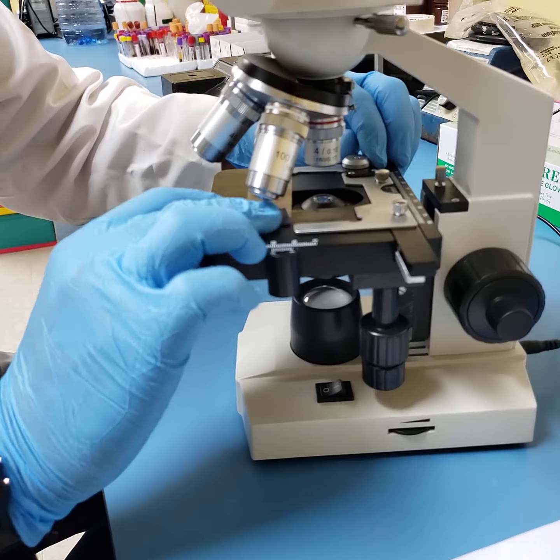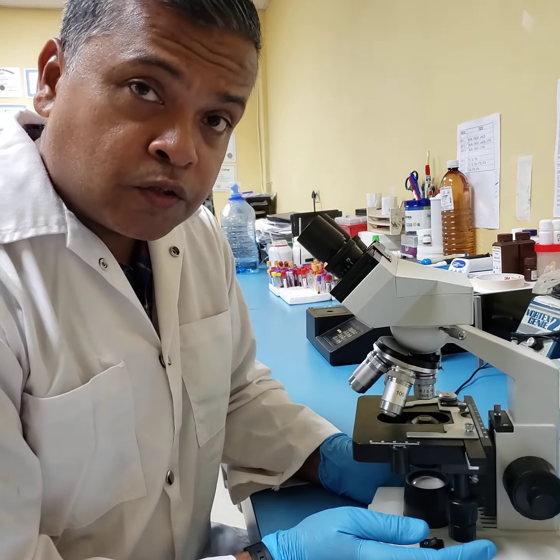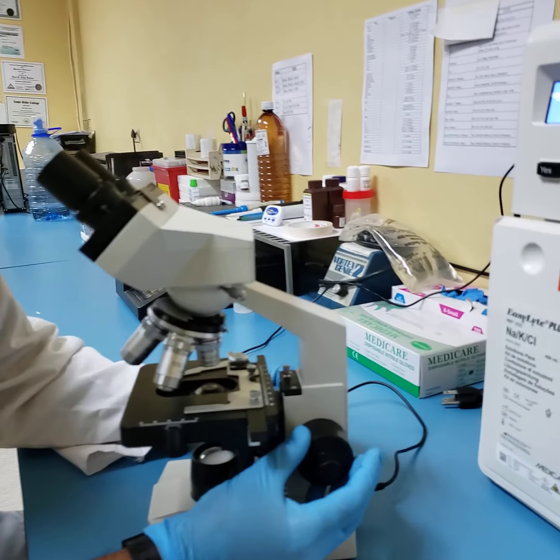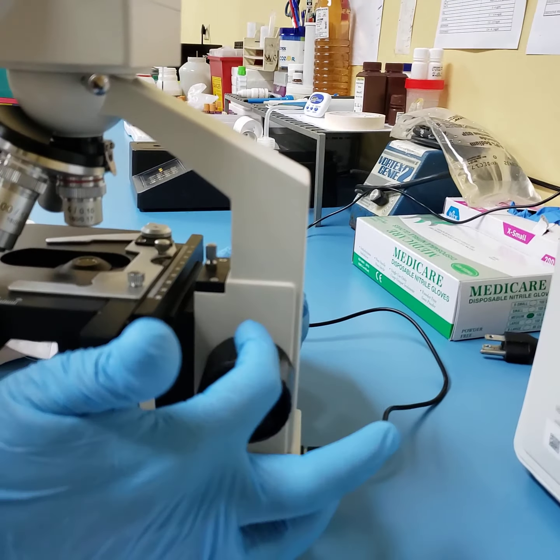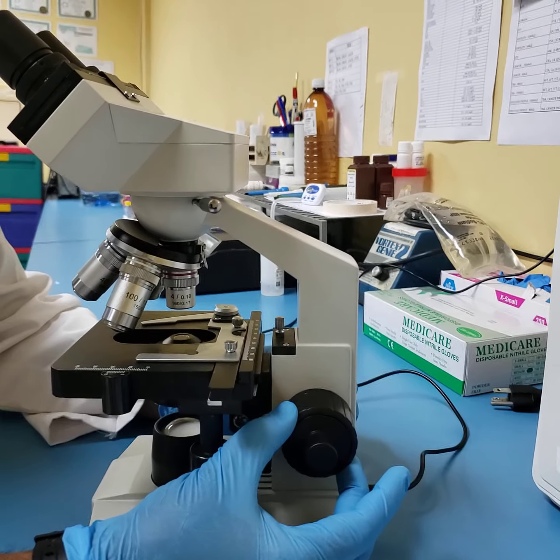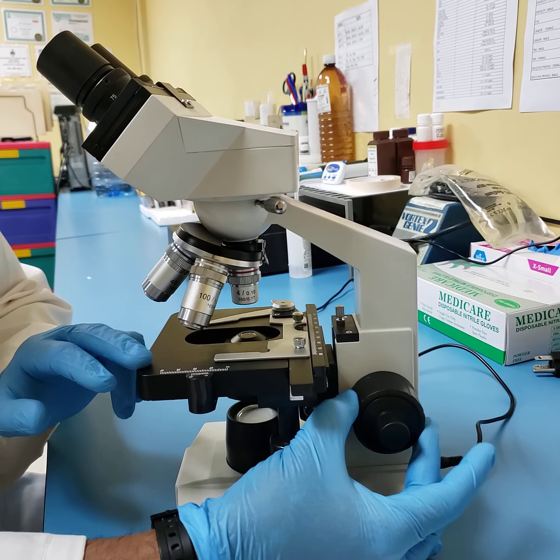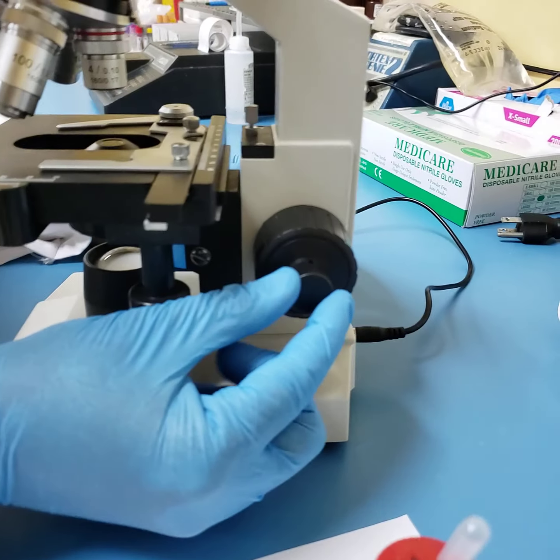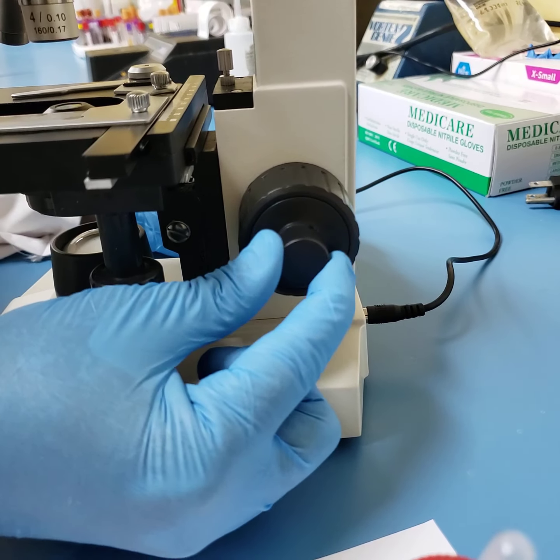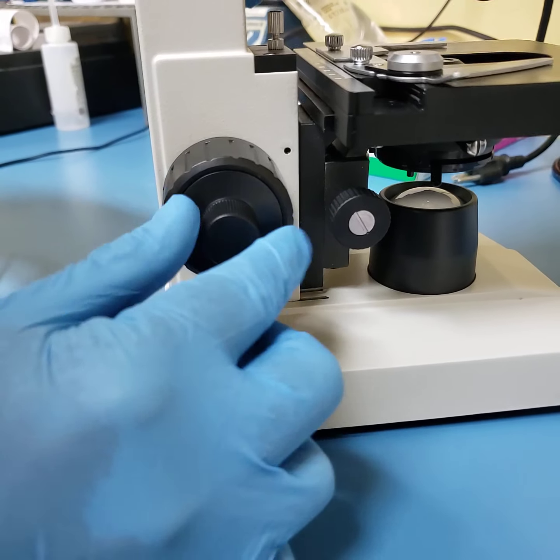What I want to also tell you about at this point is a very important aspect of the microscope, and I will show you the steps in microscopy in a short while so that you can carefully and systematically do proper microscopy work. This here at the back are your adjustment knobs. The larger circular one is called your coarse adjustment knob, meaning that turning this knob gives you a large range of movement on the stage, top to bottom. But on the outside, you're going to see another knob that is called the fine adjustment knob. This is a very important knob in your microscope. It is also located on both sides of the microscope. Coarse adjustment knob, fine adjustment knob.